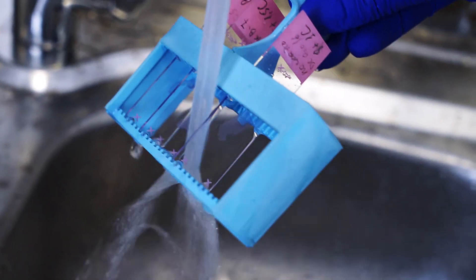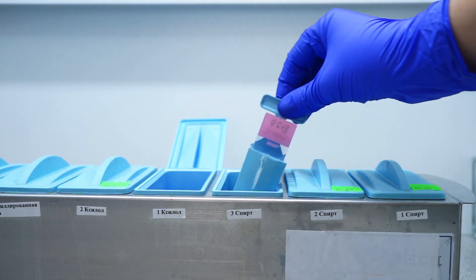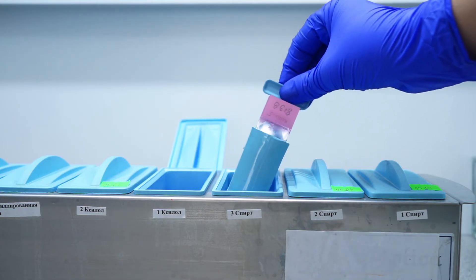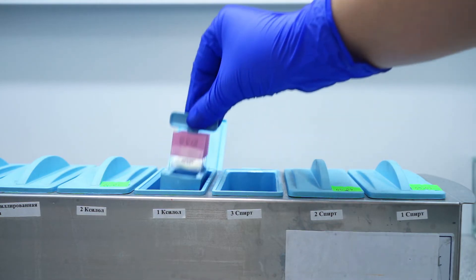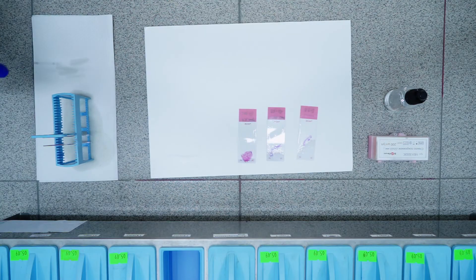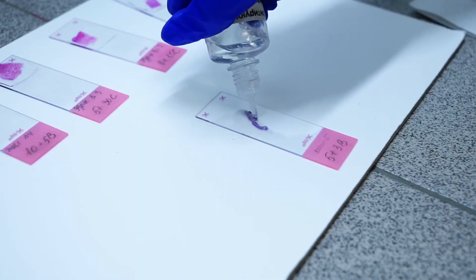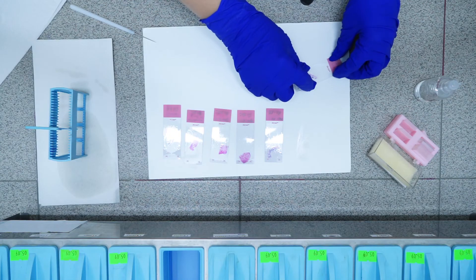After that we wash the slides, dehydrate in alcohol, clear in xylene and coverslip using embedding medium. Now they can be studied under the microscope.